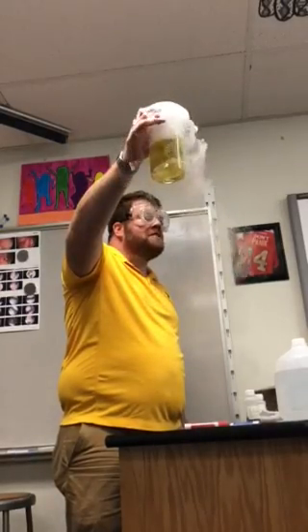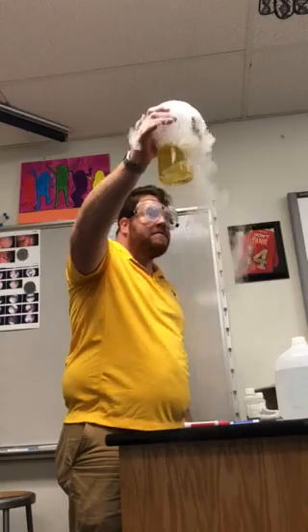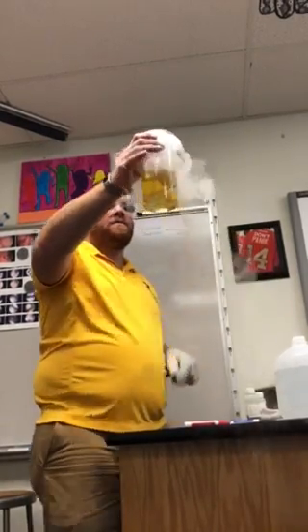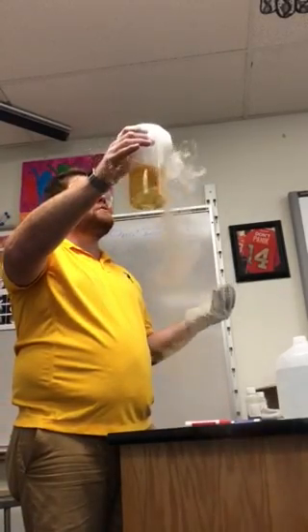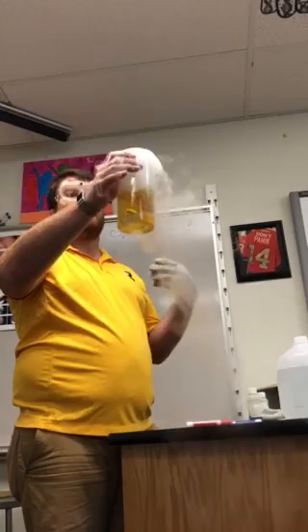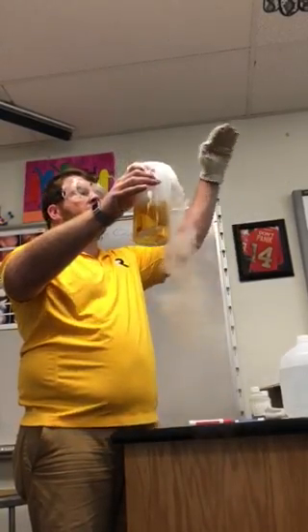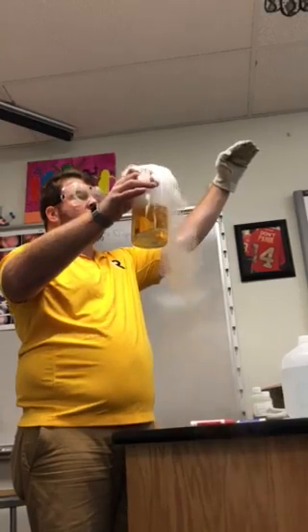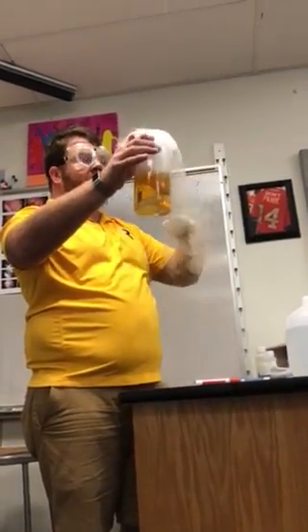This, ladies and gentlemen, is why chemistry is amazing. Can I touch this? Now, watch it. It'll continue to go on for a long time. We'll get into an orange, and then we will get into a red. Red indicates that we have created an acid. So what we've done is we went from a base, it's orange, to an acid, and we went through these different scales.